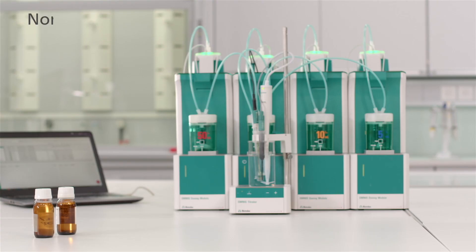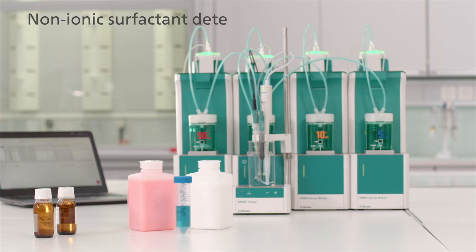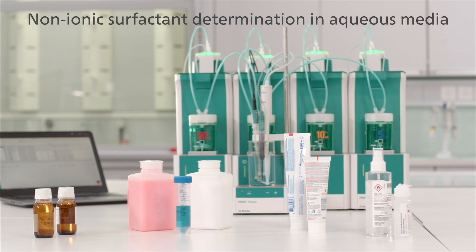It is generally possible to determine anionic, cationic and non-ionic surfactants in samples such as raw materials, detergents, toothpaste, disinfectants and more.